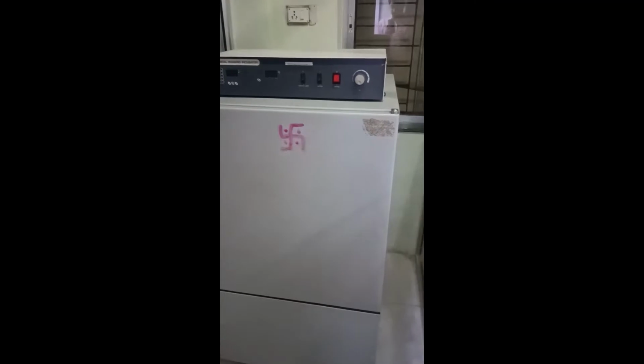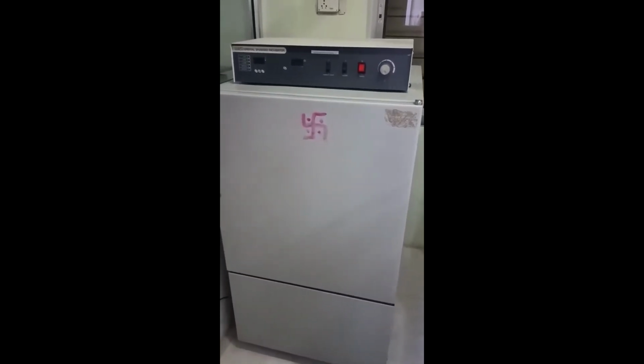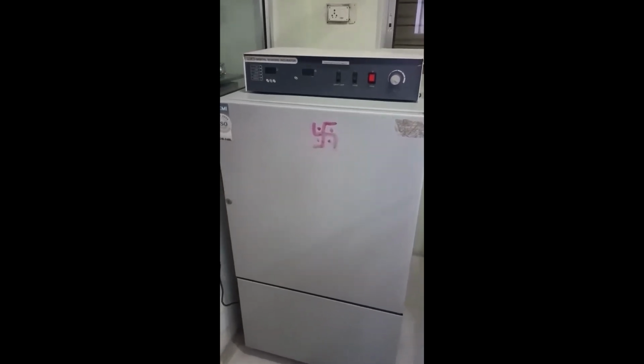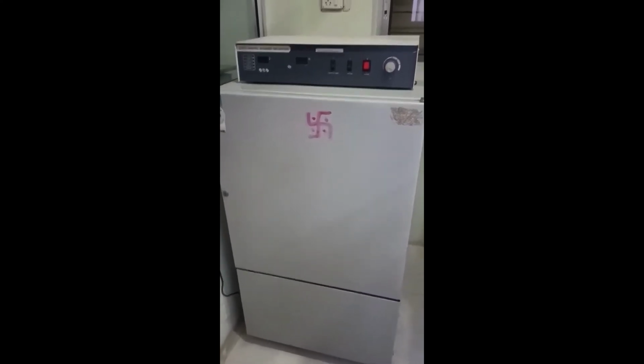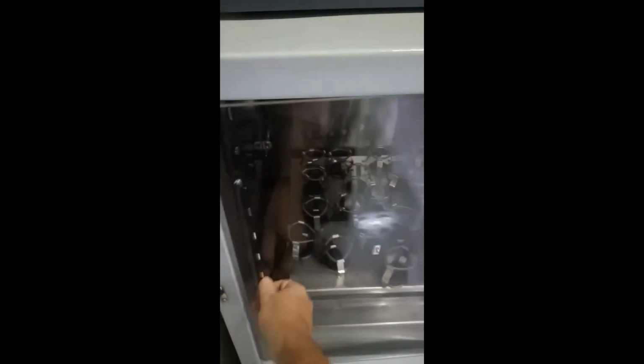In the culture lab, we see again the shaker incubator, but this shaker incubator is different from the one which you've already seen earlier. Here the shaker incubator is used for those bacterial cultures which require 37 degrees Celsius to grow, but at the same time require aeration. So let us see what is present inside. I'll open the second door, and over here you can see that it is the same general construction as we saw in the rotatory shaker.